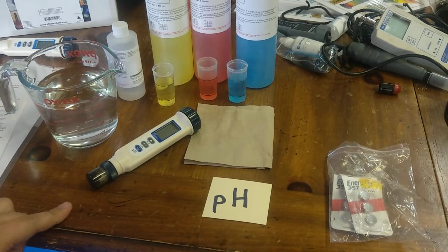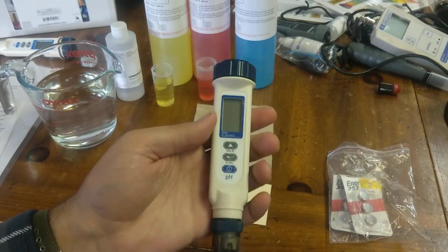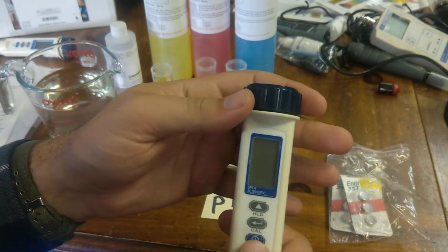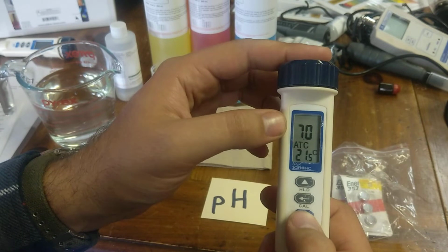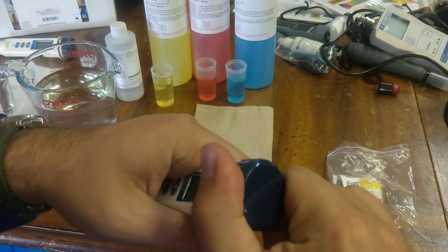All right, last one, pH. So with the pH meters, there is a couple things that you need to make sure. First of all, that it'll turn on, and does, which is good. If it's not, you'll want to replace the batteries.